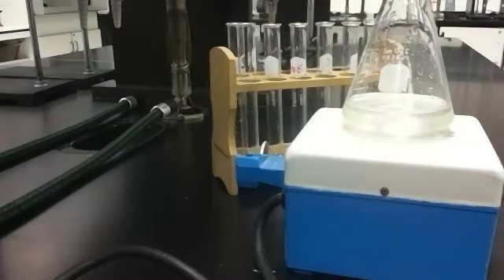Every time we add a test tube of that, when I start the reaction in a minute, you're going to see me adding test tubes. That is the thiosulfate ion. Every time I do that, it is 2 × 10⁻⁴ moles of that ion. So it's going to be interesting because when I add that ion, all right, back up just a second. When you first start the reaction, you have the iodide ion. It has a charge. The reaction is going to turn that into iodine with no charge.